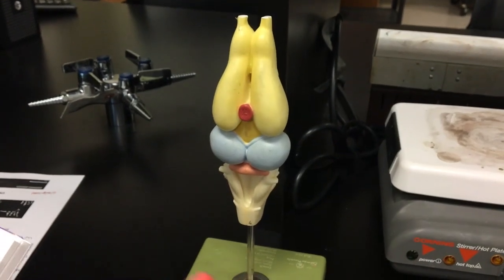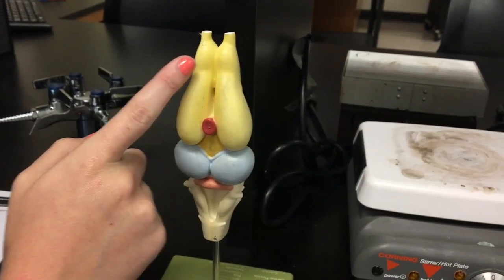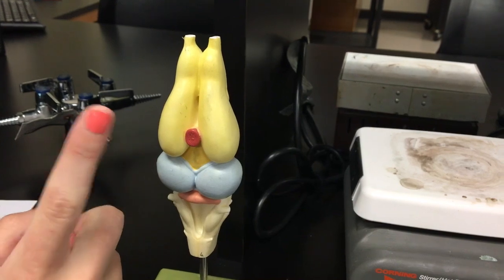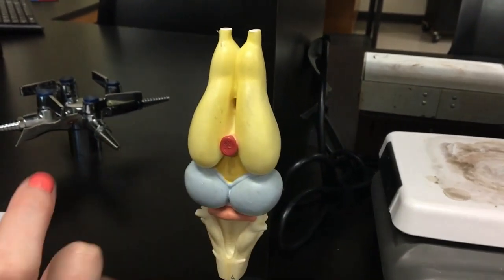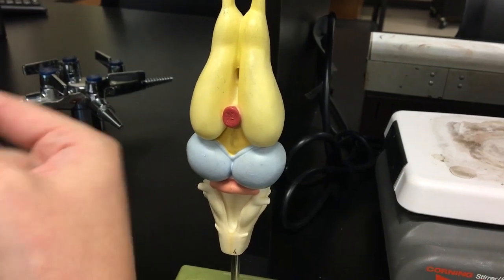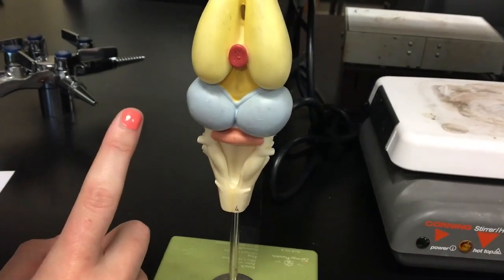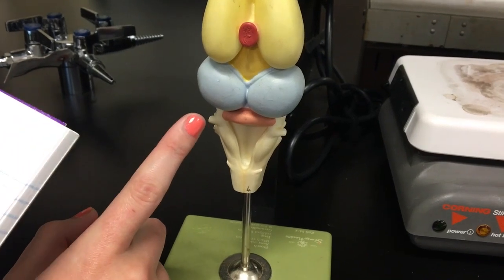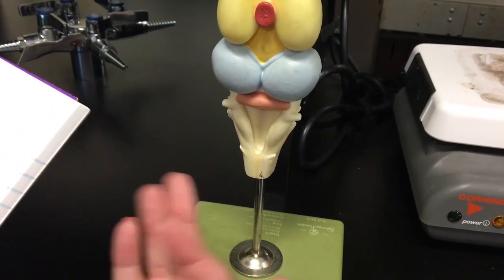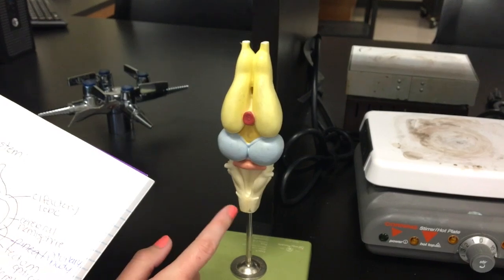This is an amphibian brain, but it is the closest related to a turtle brain. The olfactory lobe up here is responsible for smell. The cerebral hemisphere is responsible for vision, touch, smell, and voluntary muscle control. The pituitary body is used in hormone signaling. The tectum opticum is here, and the cerebellum is responsible for balance and equilibrium. The medulla is an extension of the spine to the skull and is responsible for autonomic activities such as respiration, blood circulation, heart rate, and swallowing.